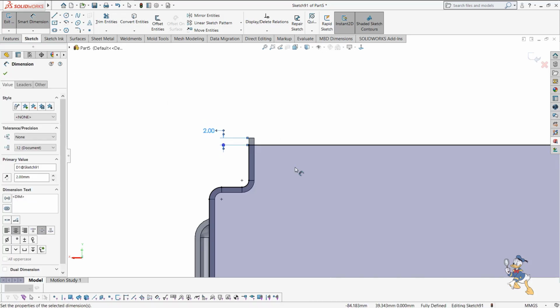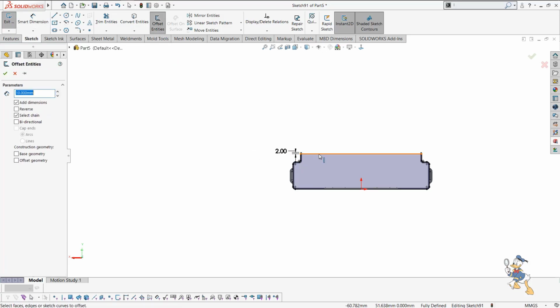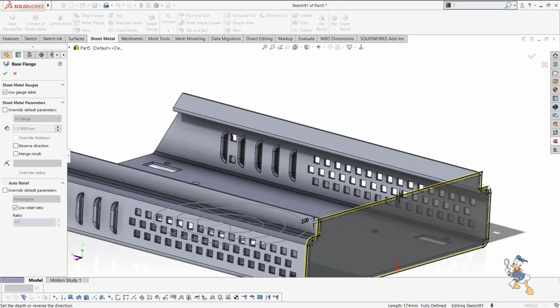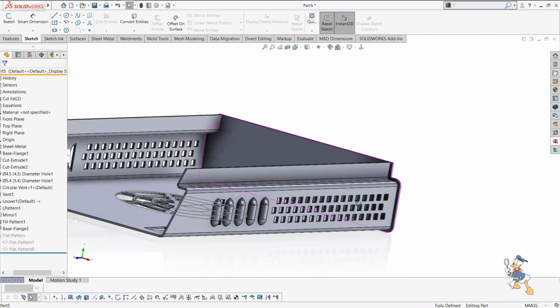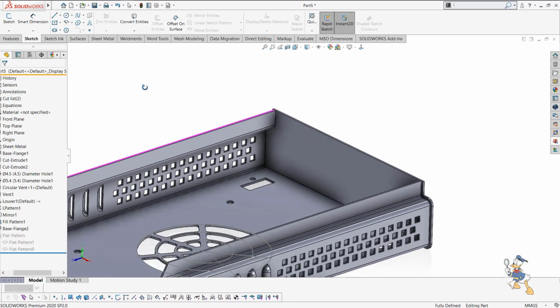So I just need to make this sketch right now, and suppose I need to use an offset feature over here, making the base geometry construction, and the offset would be like 2 mm. So it is okay for me right now, and I just need to generate a base flange feature over here, because I need to cover this part from the back side, and in the reverse direction I just need to generate this flange feature. And now a new part is developed over here in a minute only.